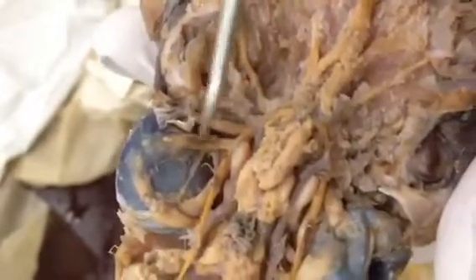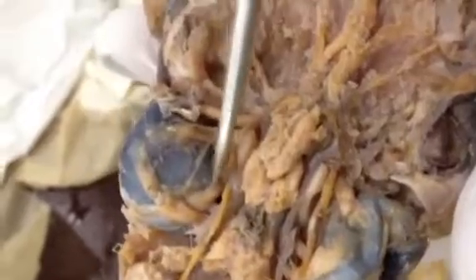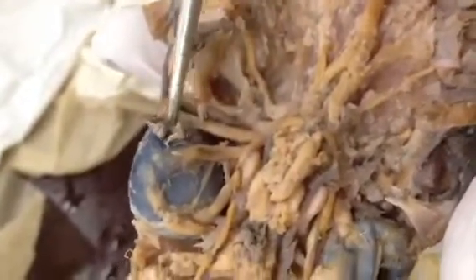We got them all. Can you show it on mine? Yes. Okay. So here is the dorsal oblique. This one is the dorsal rectus. This one is the anterior rectus. This one is lateral. That's pretty good. This one is the ventral rectus. This one is the ventral oblique. That's it. We got them all.